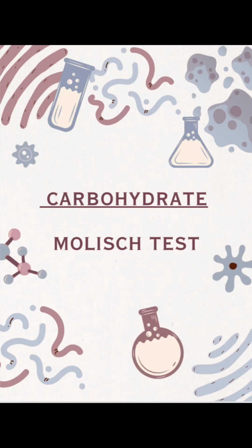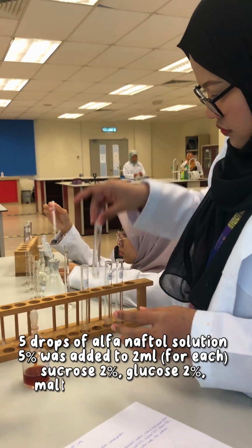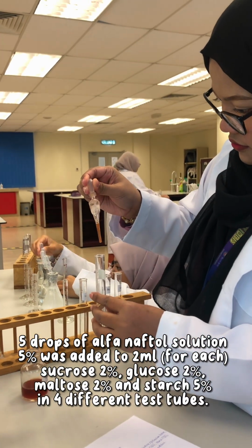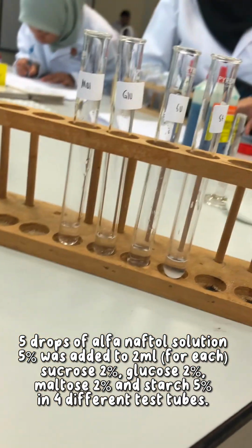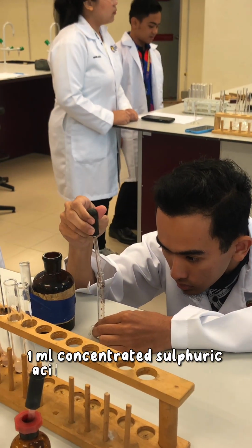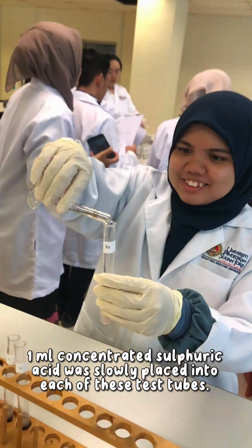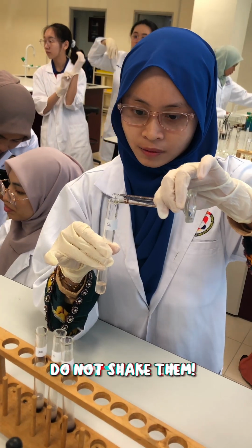Firstly, the carbohydrate Molisch test. 5 drops of alpha naphthol solution, 5%, were added to the test tubes, and 1 ml of concentrated sulfuric acid was added into each tube. Make sure not to shake them.